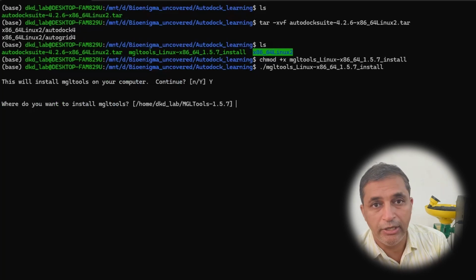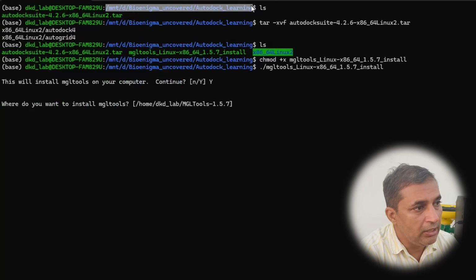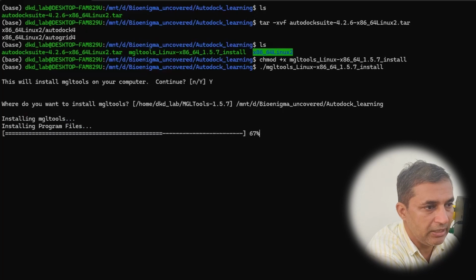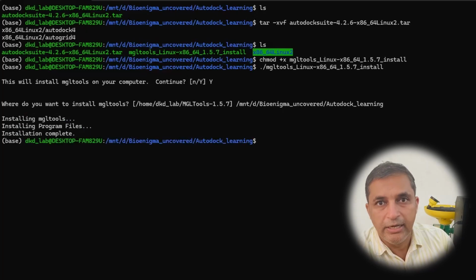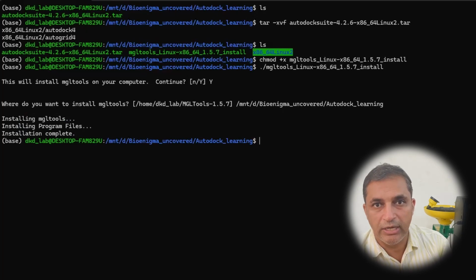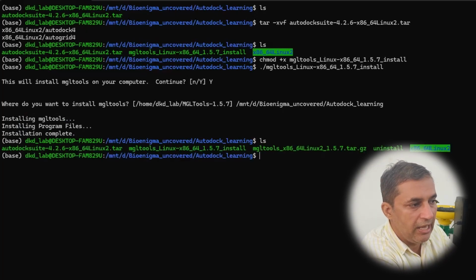Of course, I need to basically specify my folder. So what I am going to do is I'm going to copy paste my folder name, and once I copy paste it here, I'll hit the enter button. It is going to install this MGL tools. As you can see, to verify this, I'm going to type the ls command.